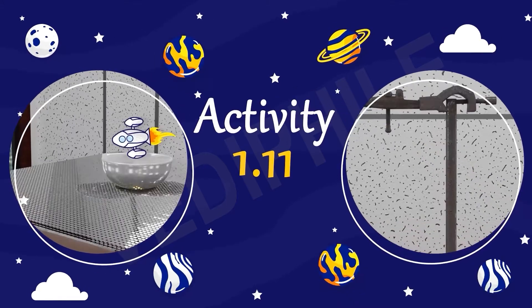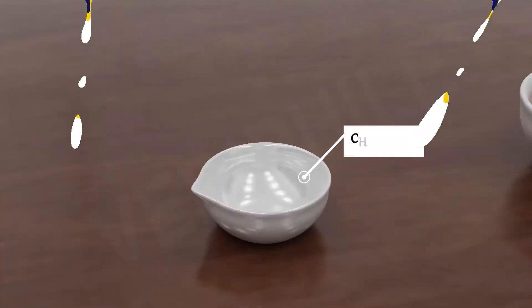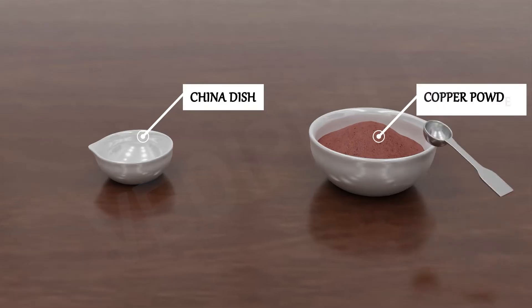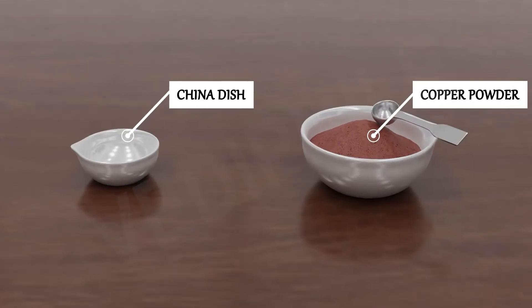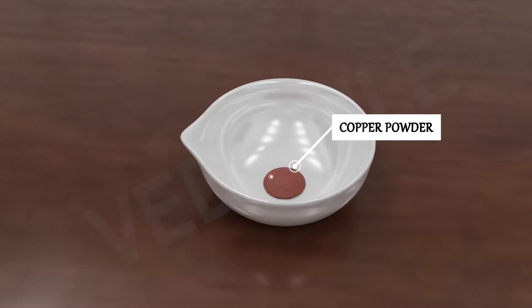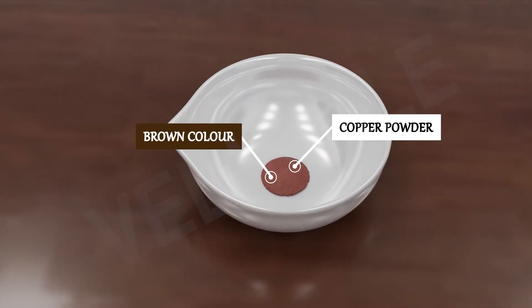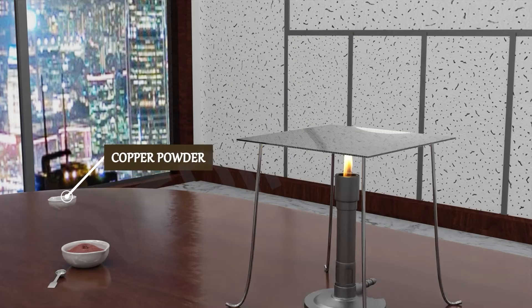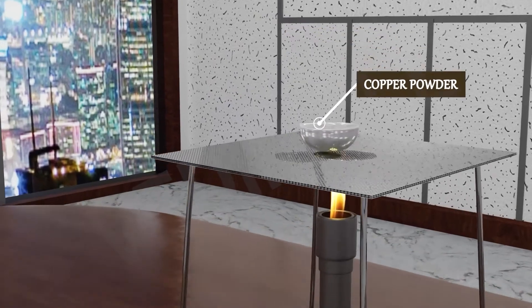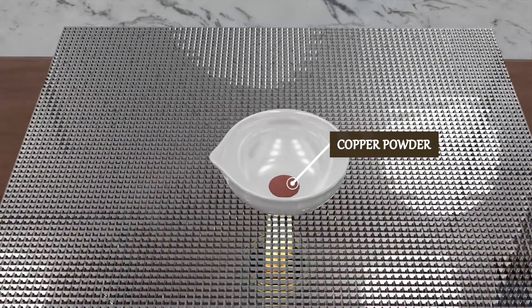Activity 1.11. Can you see this china dish? Take 1 gram copper powder. The color of copper powder is brown. Now heat this copper powder and observe the change in color.